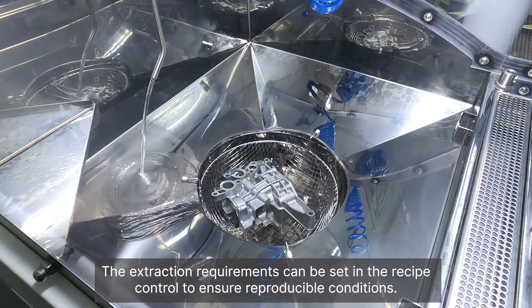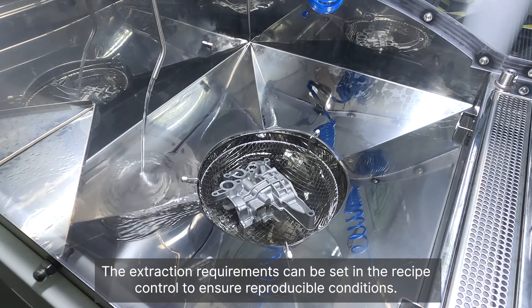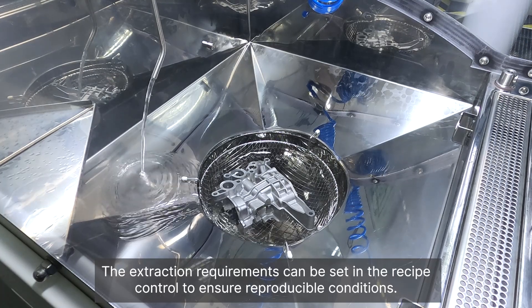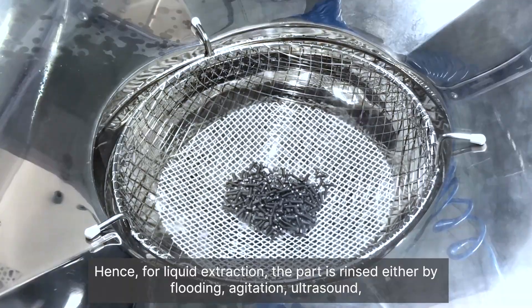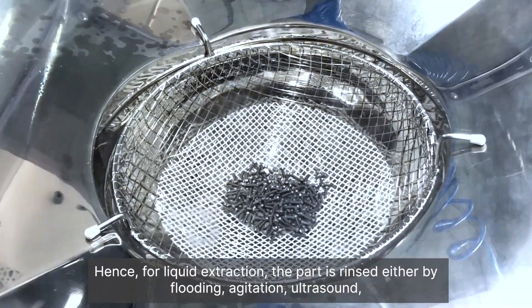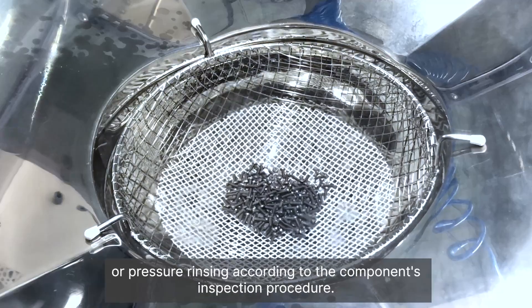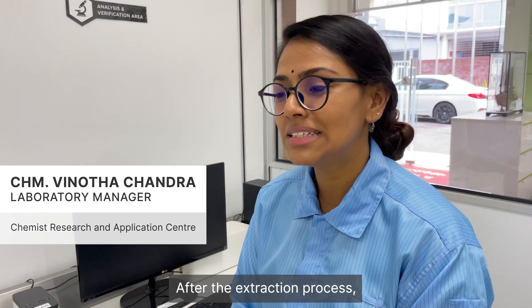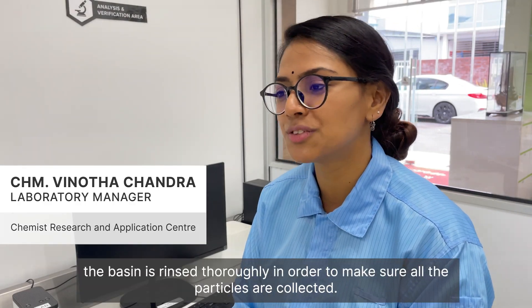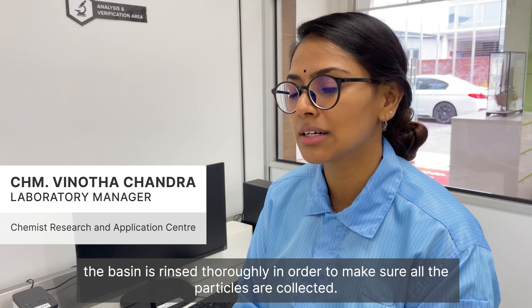The extraction requirements can be set in the recipe control to ensure reproducible conditions. For liquid extraction, the part is rinsed either by flooding, agitation, ultrasound, or pressure rinsing according to the component's inspection procedure. After the extraction process, the basin is rinsed thoroughly to make sure all the particles are collected.